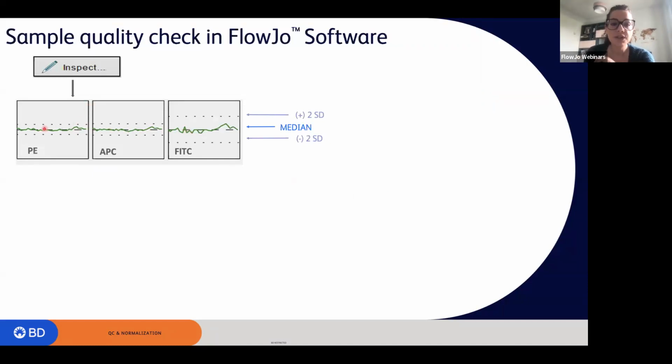What you see here, the green line is the median value and the two dotted lines are the two standard deviations. As long as the median value is included within the two standard deviations, it means that there were no alterations during the acquisition. So basically we didn't have clogs or air bubbles or anything that could compromise our data.